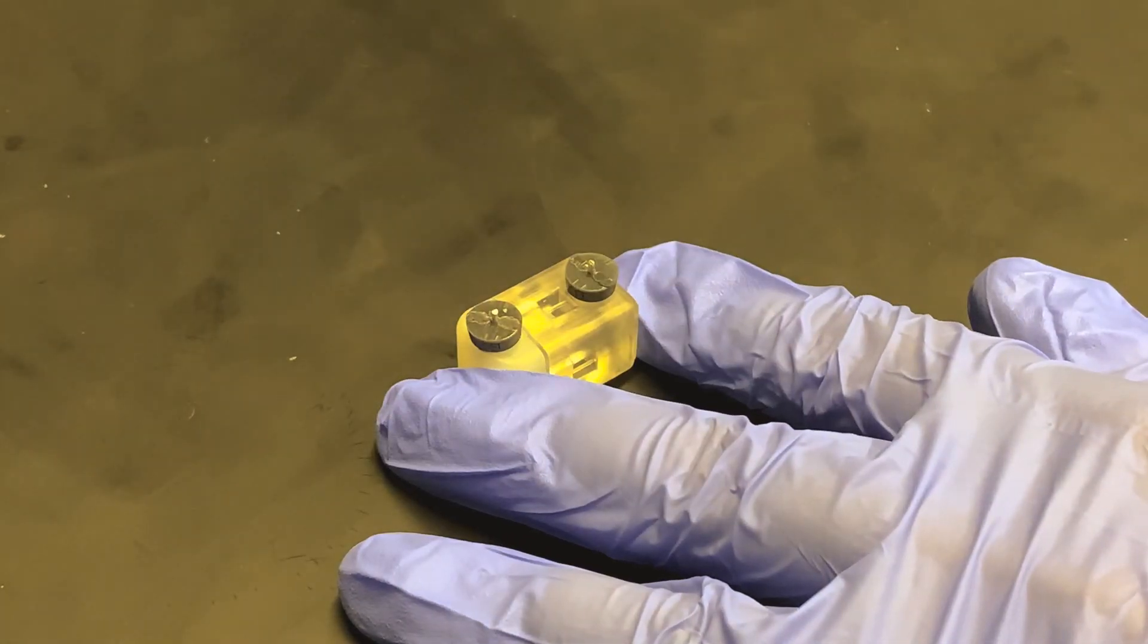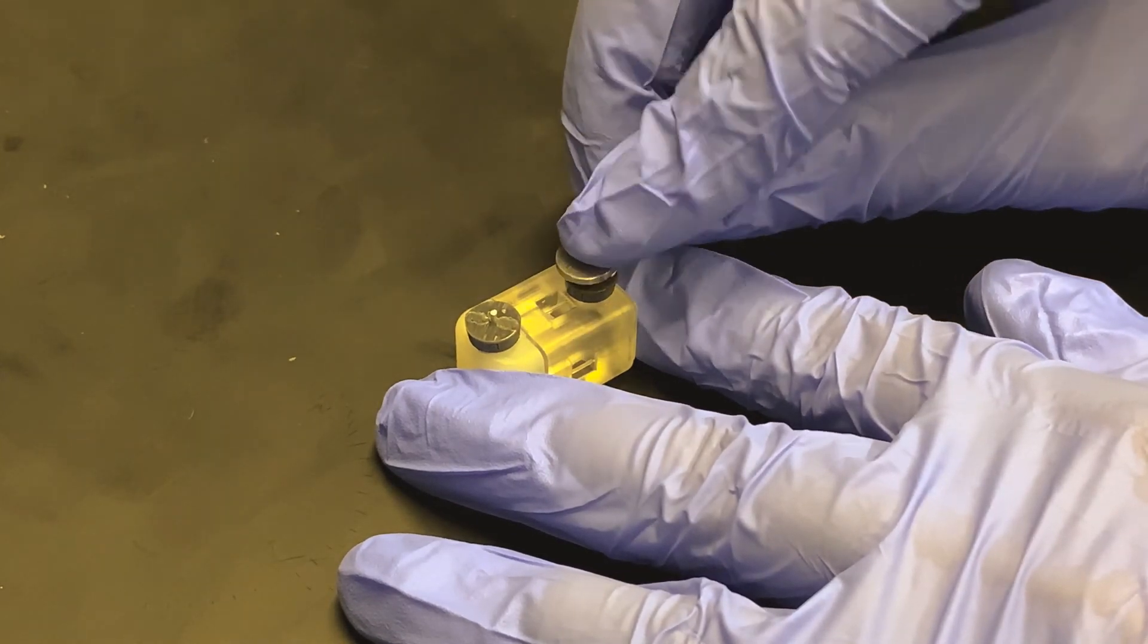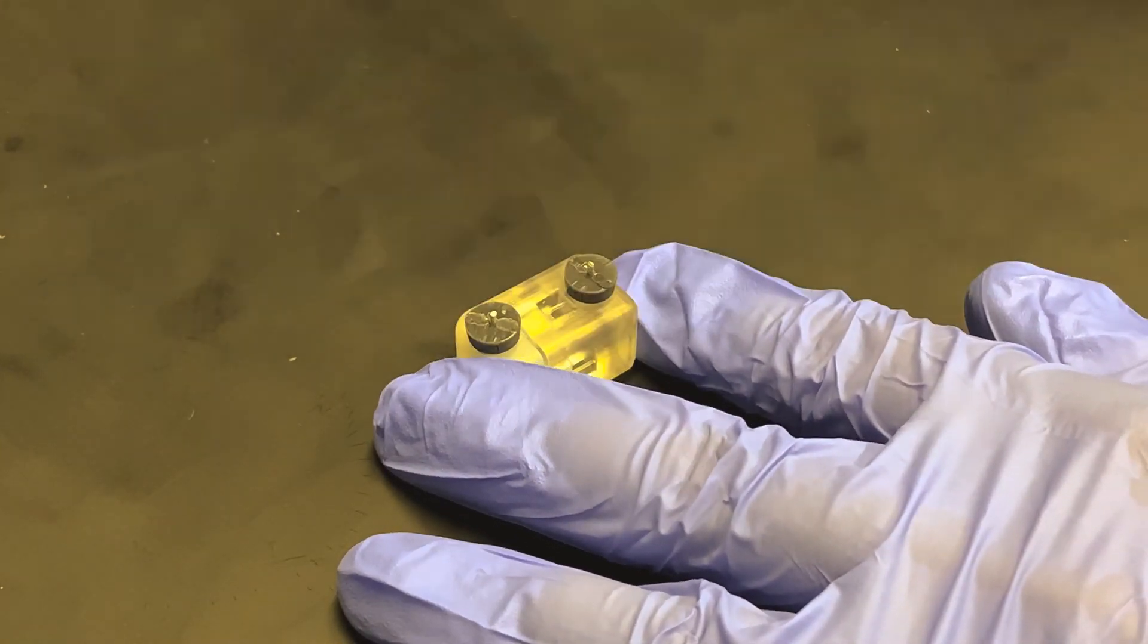To make sure the silver wire is at the right height, I will take my tweezers and just tap them down, and we're good to go.